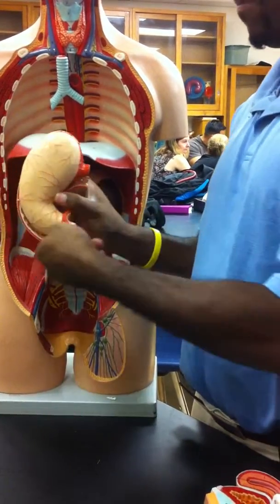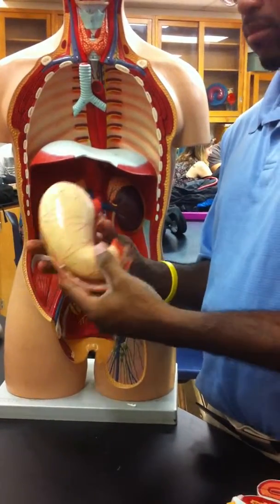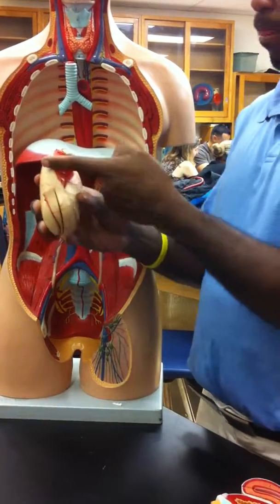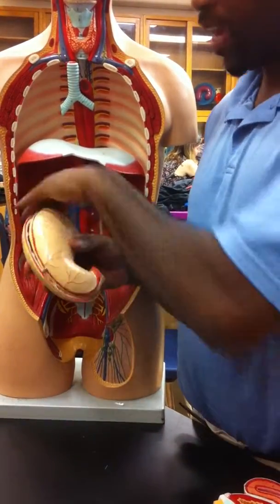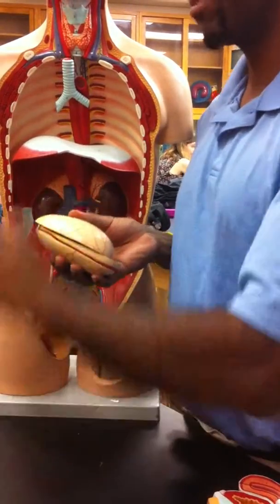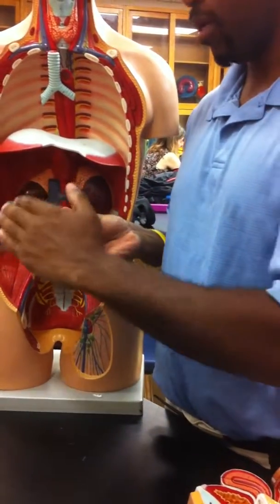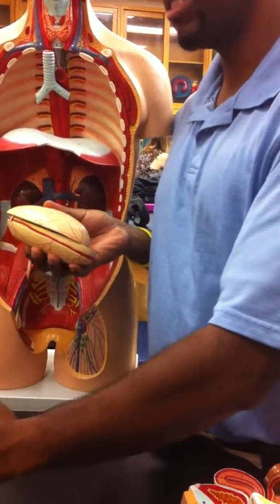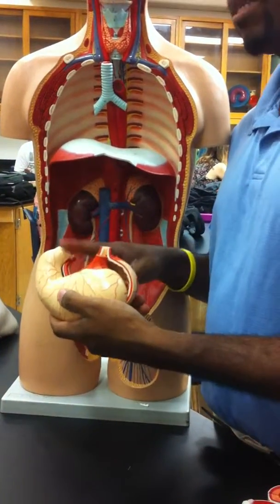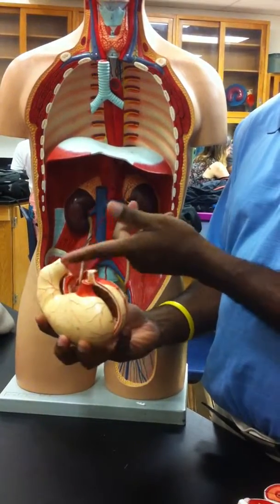Notice there's a huge curve — we call that the greater curvature of the stomach. And then a small curve, the lesser curvature. With the big curve there is the lipid-dripping connective tissue, we call it the greater omentum. So it will be dripping over the intestine. And then the smaller curve has the smaller omentum — the lesser omentum. Just for you to remember for lecture.